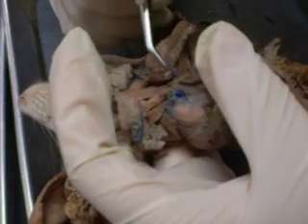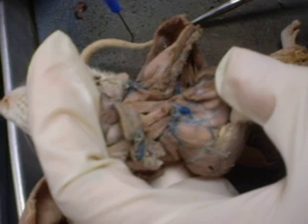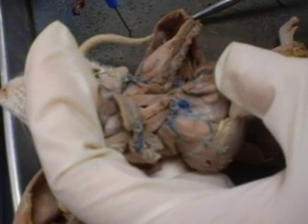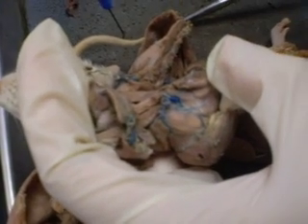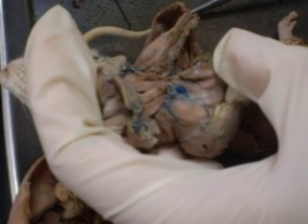The external ones are the cleidos. So you have cleidocervicalis, cleidomastoid, sternohyoid, sternomastoid, and omohyoid. So start by outside to inside. The outside ones are all the cleidos. Cleido refers to your shoulder.